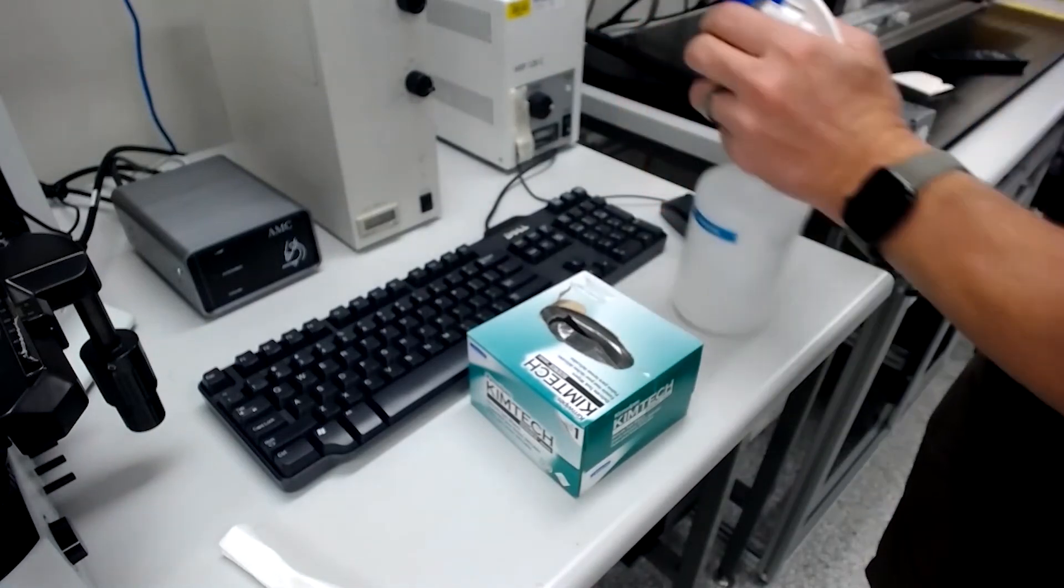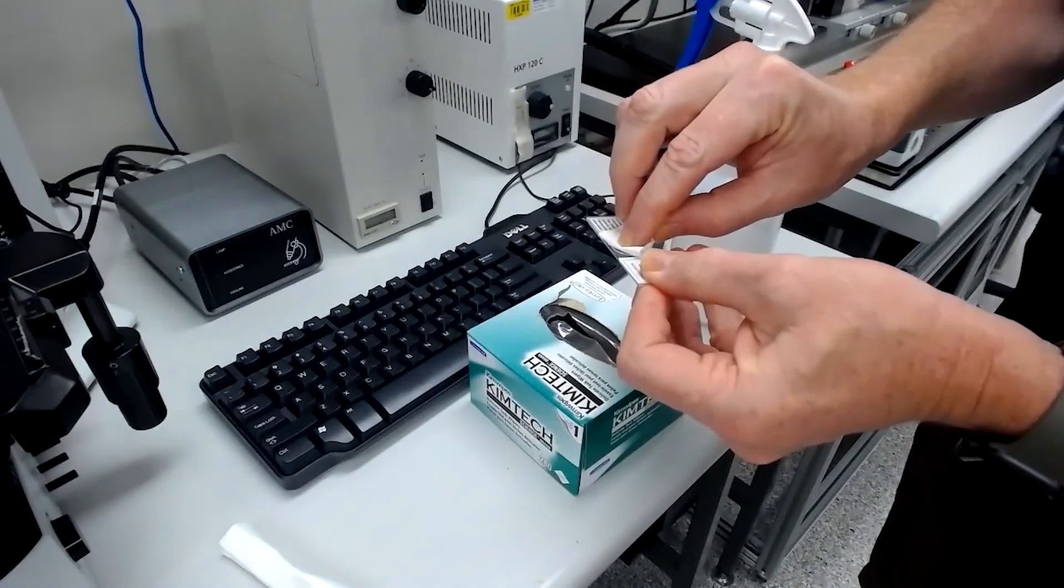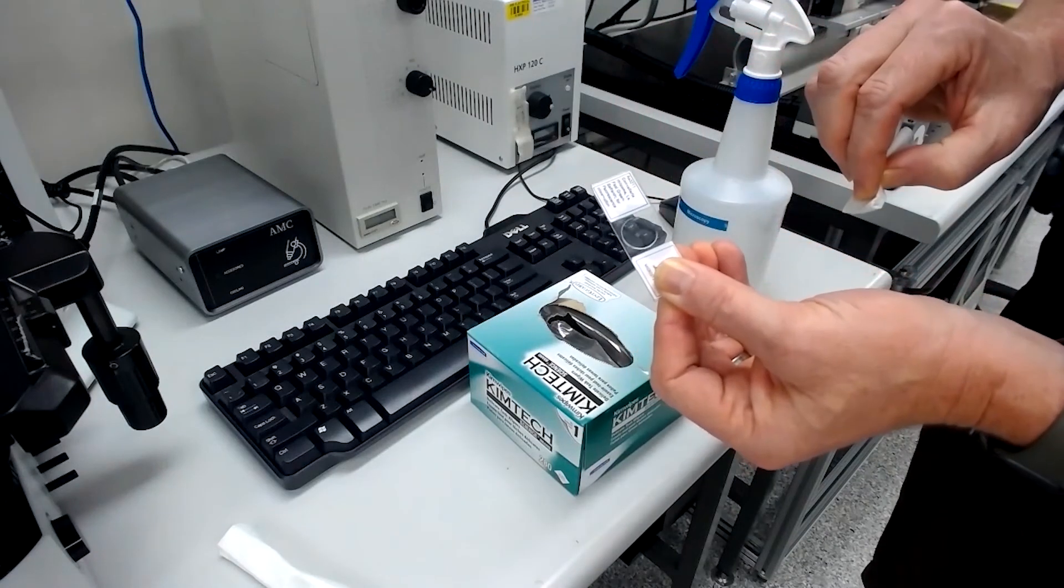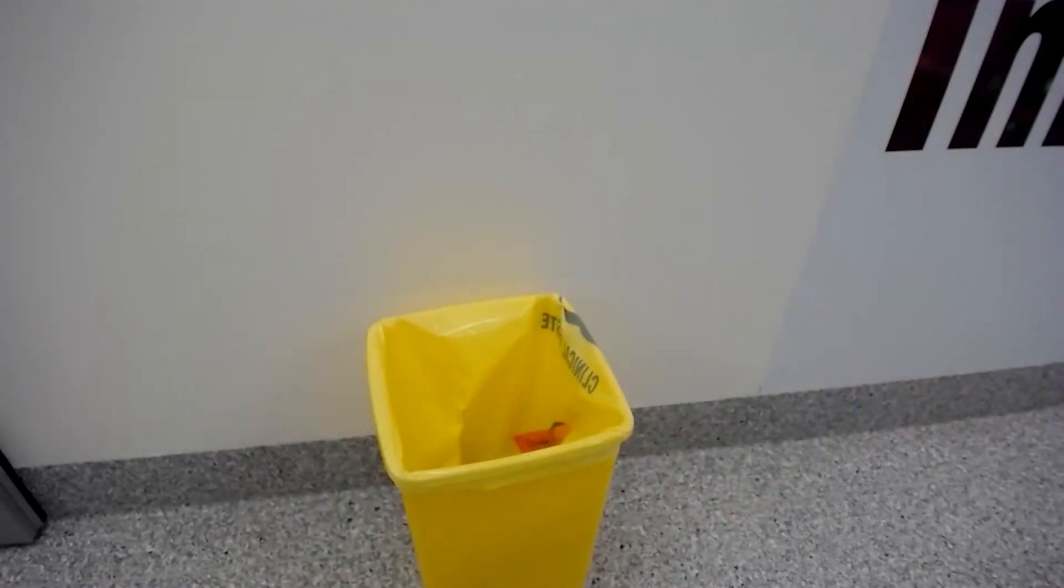Do not use ethanol or other solvents when cleaning our objectives before or after use. Be considerate and throw all tissues in the bin.